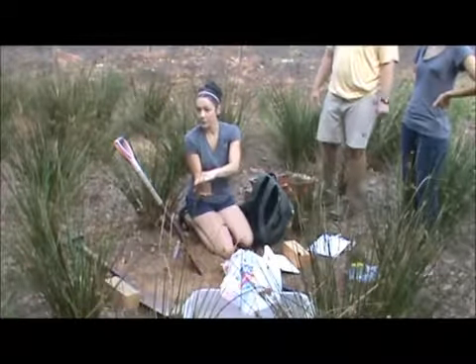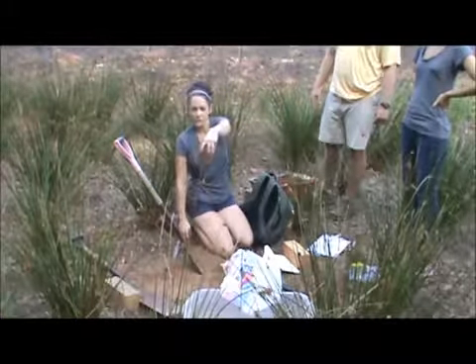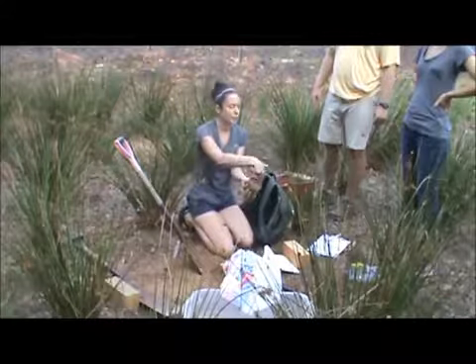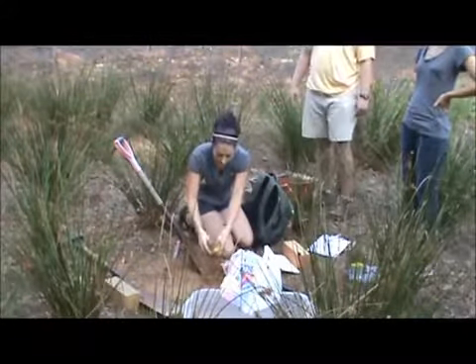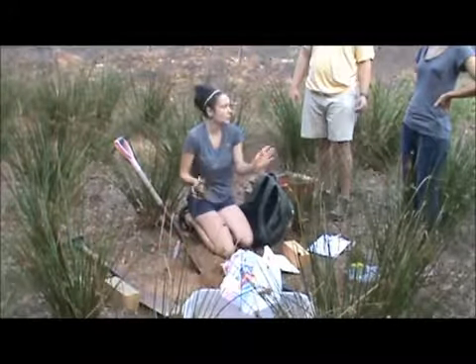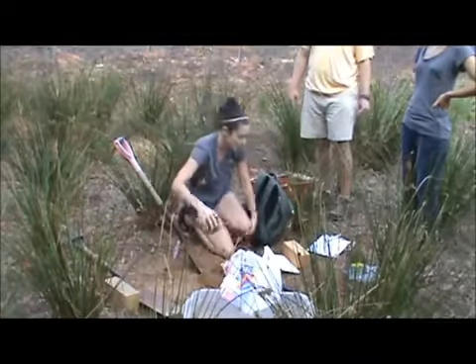You don't want to disturb it too much after this — just set it right in there. But if you hold it like this, see how it just starts falling out? Then you've messed up the volume. So that's how you're going to take your samples. If you do drop soil like that, just empty it, do it again, move over one step and do it again in a new spot.